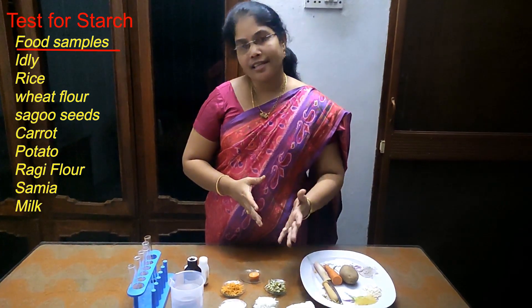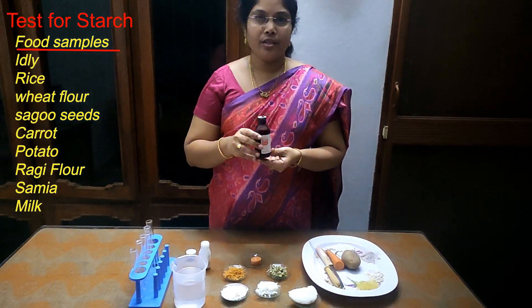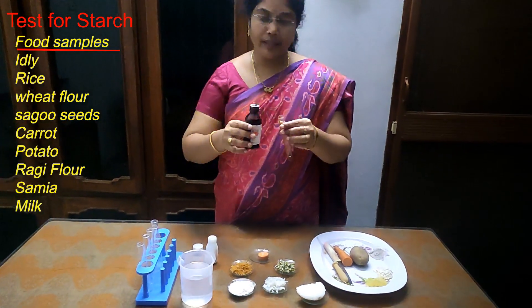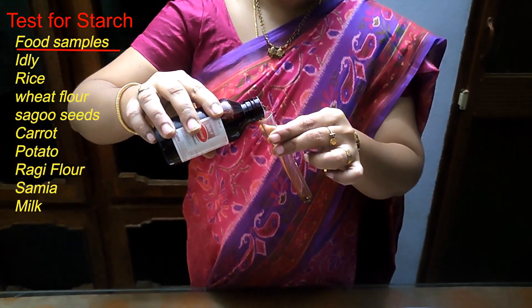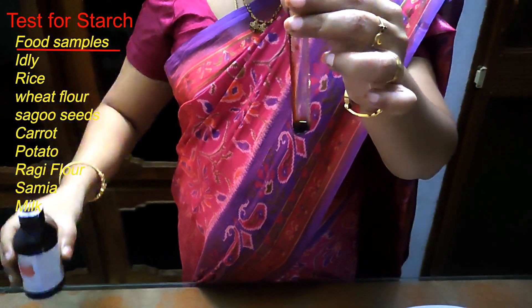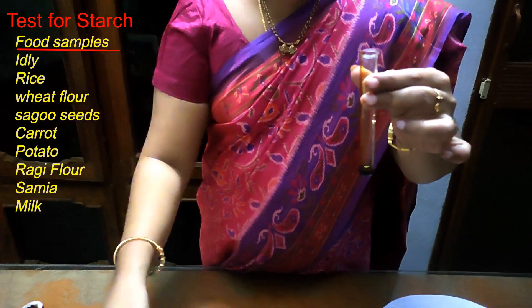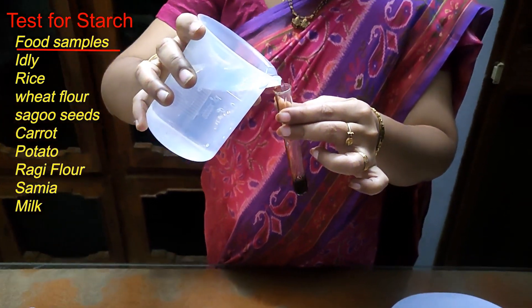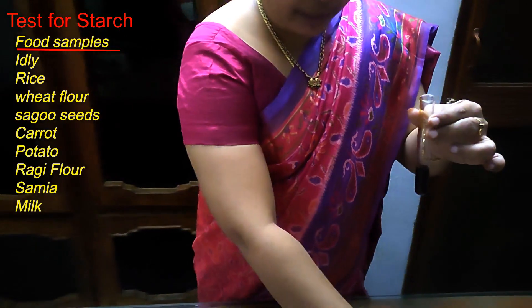To test for starch we need a chemical, that is iodine. We take this iodine in a test tube. This is concentrated iodine which is brown in color. When we add water to it, it changes to yellow color. We can observe the yellow color on the margins of the dropper.